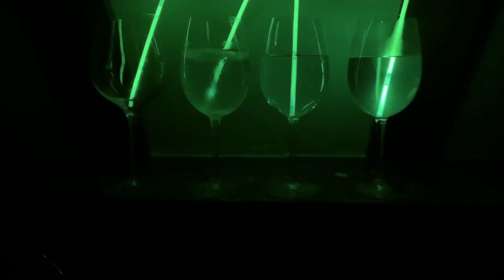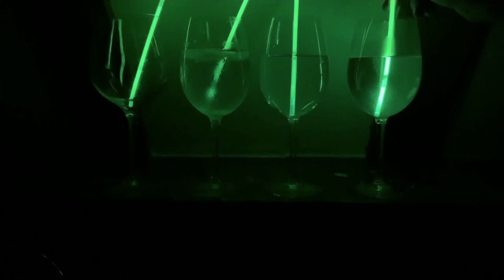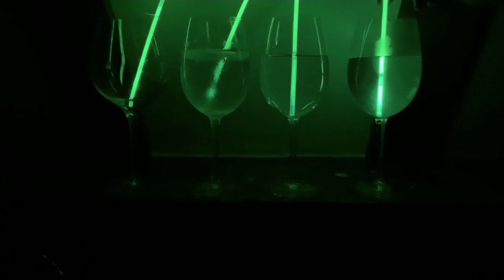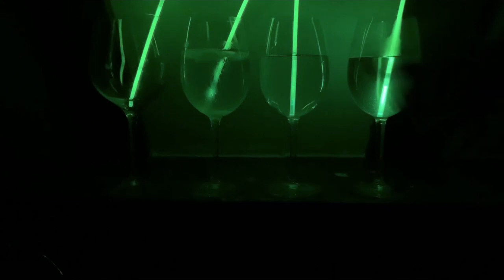The other thing that you, if you get really close to these, might be able to see are bubbles. And it might be something that you might want to observe maybe more at the start of the experiment, but sometimes you can see sort of bubbles rising.